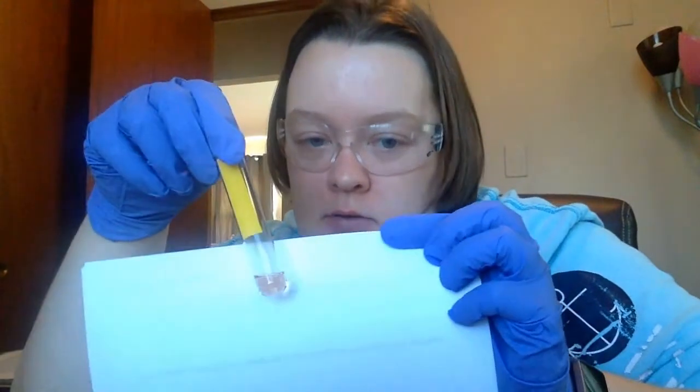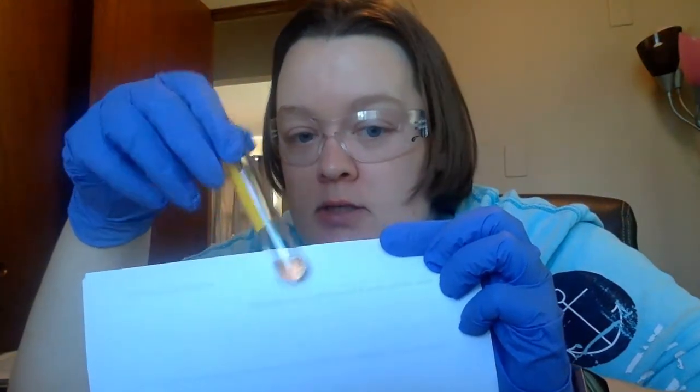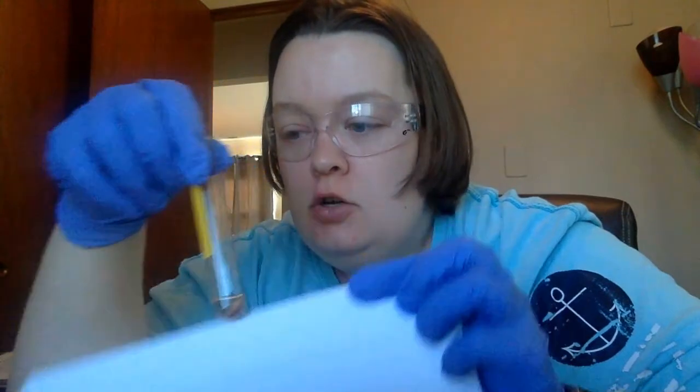But then when we washed it with a base, we got this red substance. This is going to be the ruffinotoxin. So in total, our initial sample contained 4 things. We separated out 3. In part 1, we separated out 2. 2 things were in that 1 from part 1. So we had 4 total substances that we separated out, one of which was ruffinotoxin.